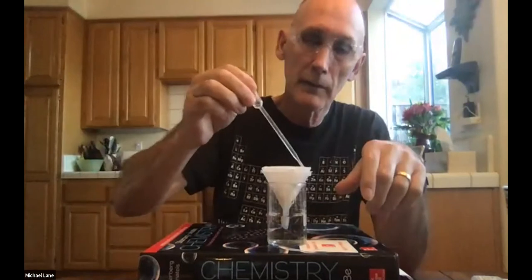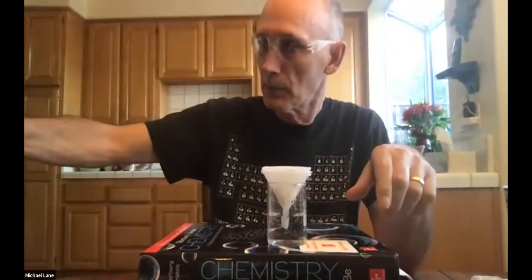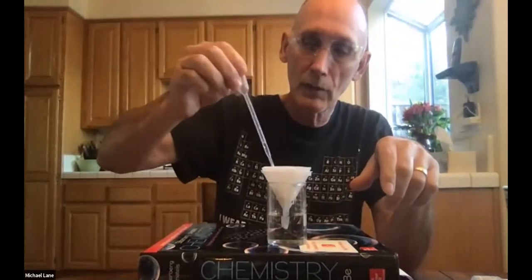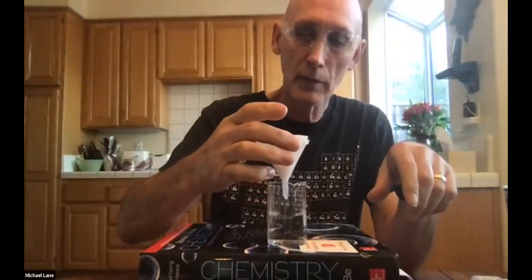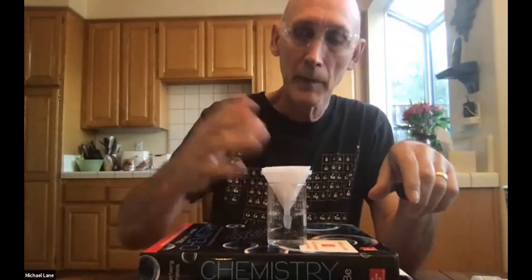So I'm going to give just a little bit of, we say, washing the precipitate, which is just another way of saying washing out the sodium chloride that might be in there. Okay. So now that I've added just a little bit more, we can see, there we go. It's back to dripping. So I'm going to leave that sit there for a moment.